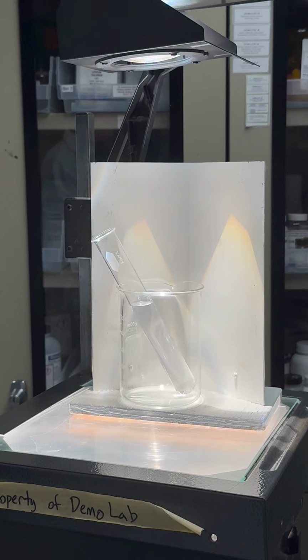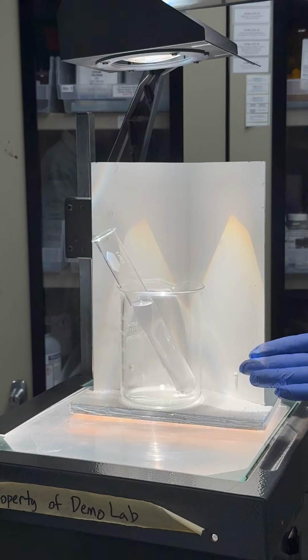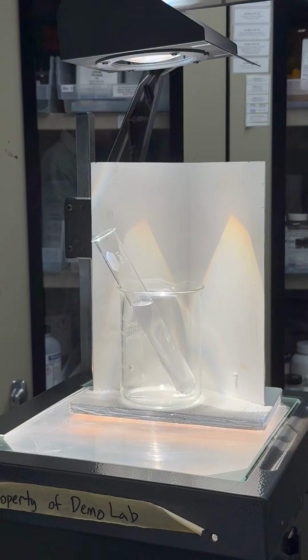I see why we had iron sulfate and thionine, but why do we need sulfuric acid? This reduction with intense light can only take place under acidic conditions, so we needed to add an acid solution to make an acidic environment.